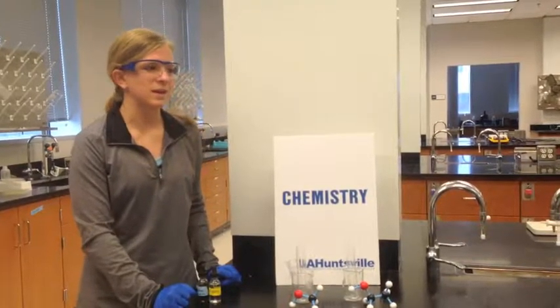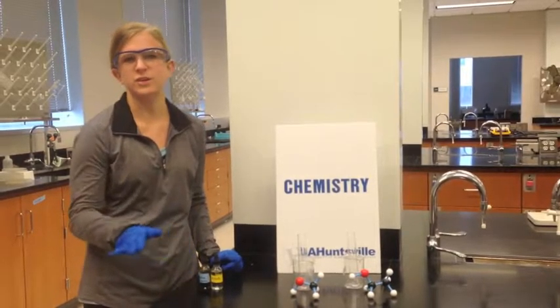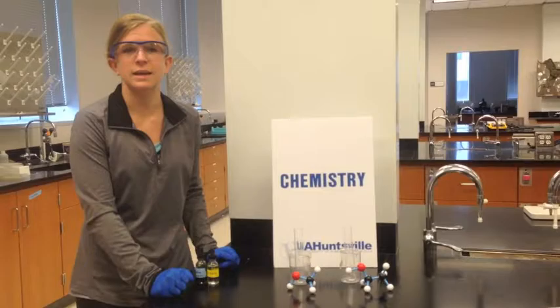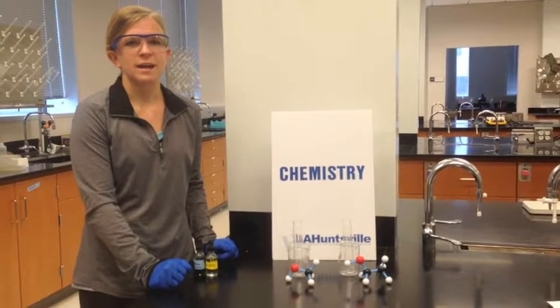So this is an organic chemistry demonstration, and you guys have been learning about the different structures and uses of different organic molecules. So today we're going to be looking at two alcohols, methanol and ethanol, and seeing how they react with iodine and sodium hydroxide solution.